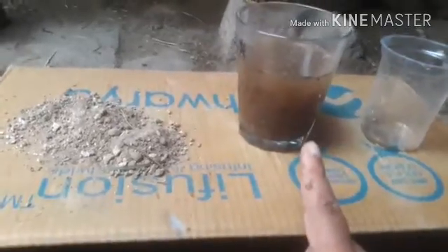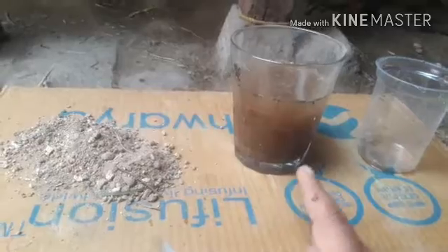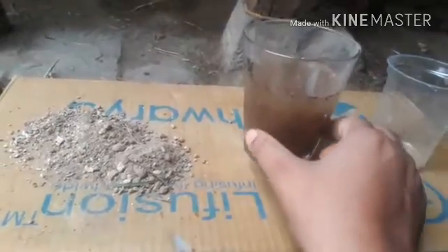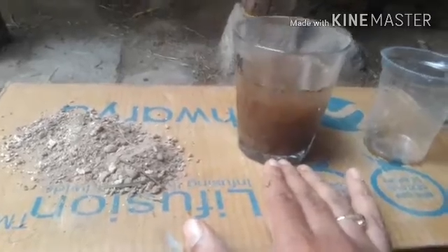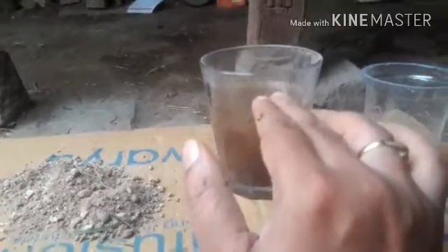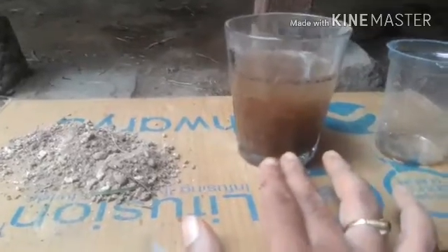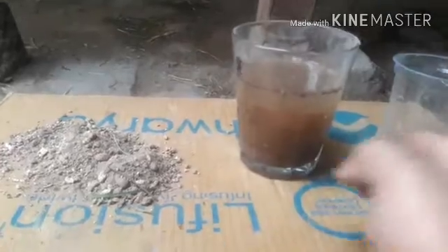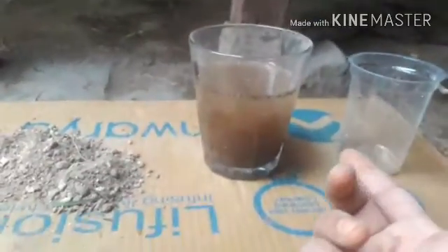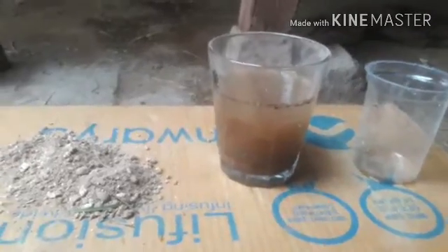So if you keep it without moving, without disturbing, then it could be stabilized and slowly the particles will come down, right? Whereas water remains at the top and soil particles may come down. So this is what we call sedimentation. After that we'll take the water from this, that is decantation. Okay, sedimentation and decantation. Let us wait for 5 minutes.